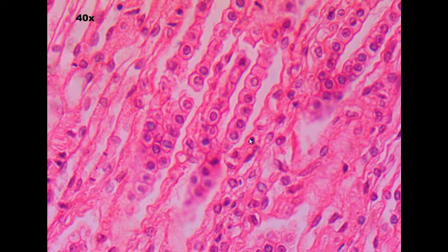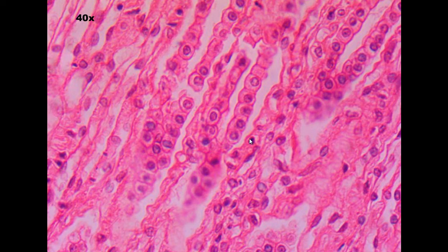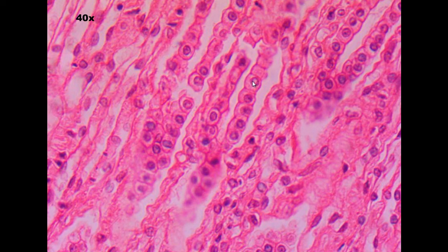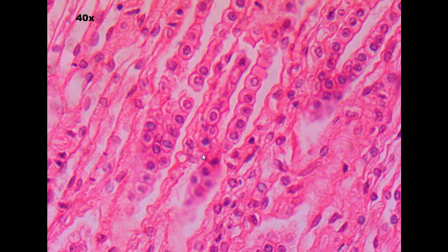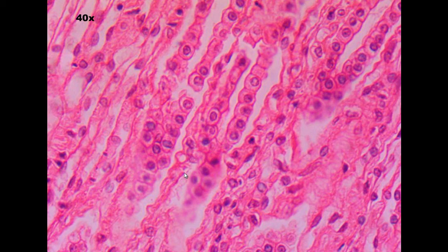This one: cilia? No. Cells irregular? No. Single sheet? No. Does it have little buckets of cells? No. Does it have square shaped cells making up tubes? Absolutely. That's a pretty square little cuboidal cell, and I can see little tubes here. So that's my simple cuboidal.